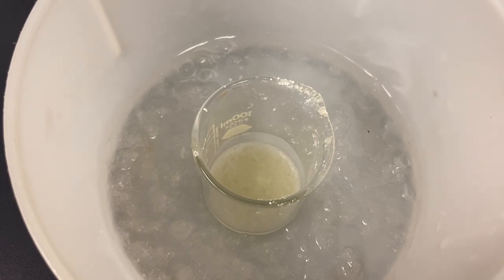That will help us dry the product. And this won't take too long to dry because ethanol evaporates a lot quicker than water does.